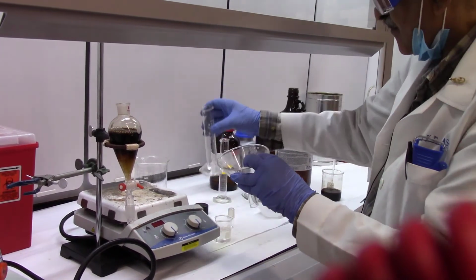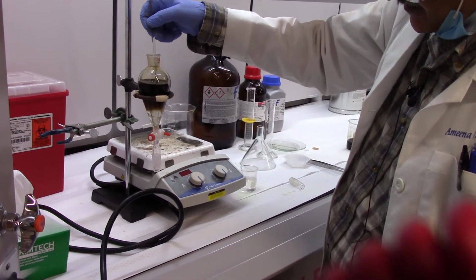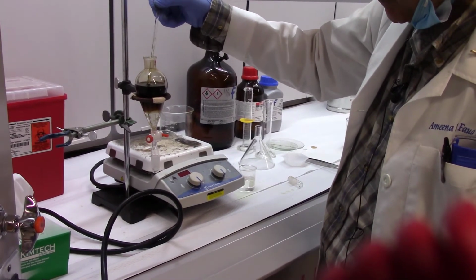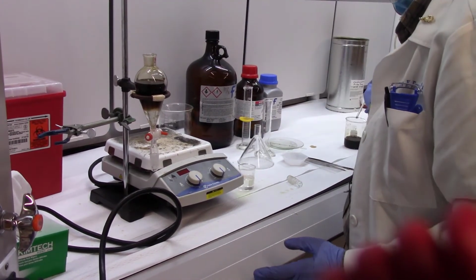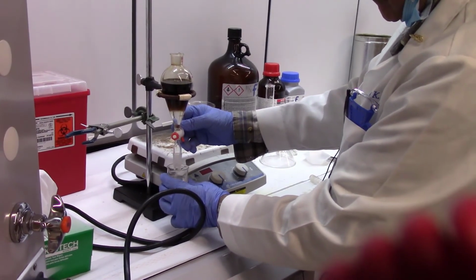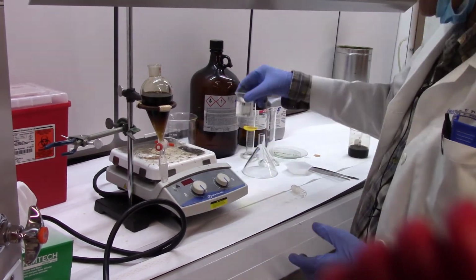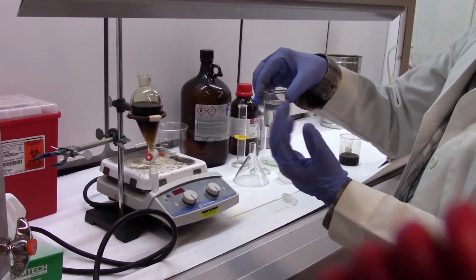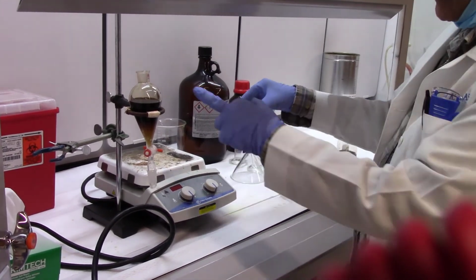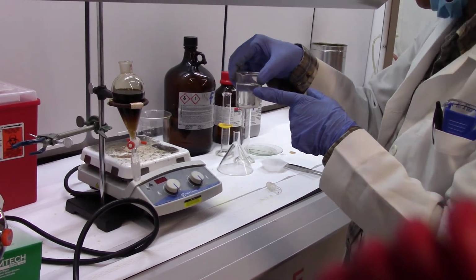You add DCM and repeat the entire process again. Basically, you shake the separatory funnel up and down, and after that use swirling and a glass rod to agitate and break the bubbles, and drain off the third layer, and combine all these three extracts into the same beaker. Okay, now there are three extracts over there.